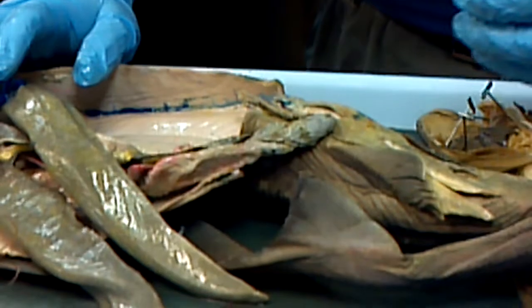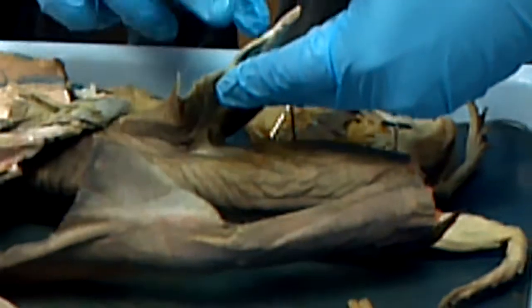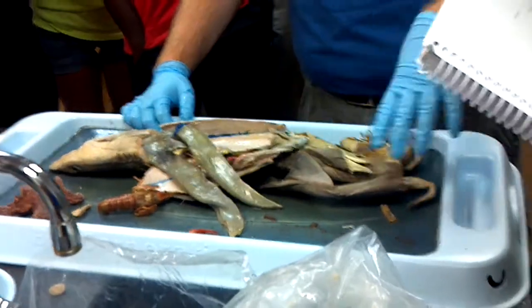What's the external stuff that distinguishes male and female? Claspers, right here. Also, the females are much bigger, but I guess we could get a female that was smaller. This is a particularly large male.